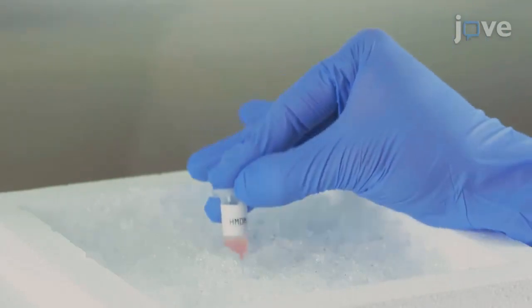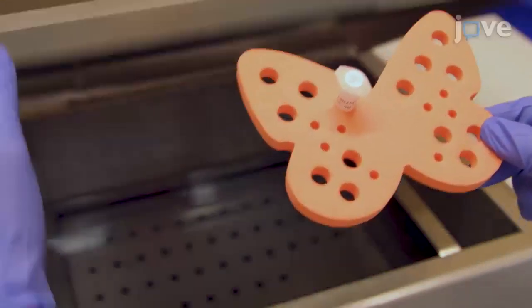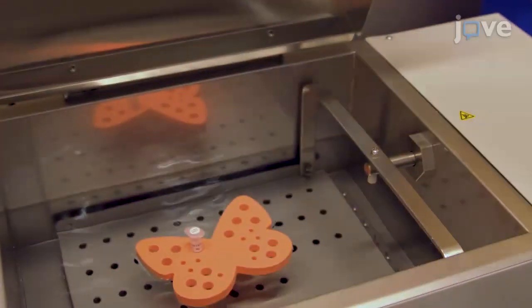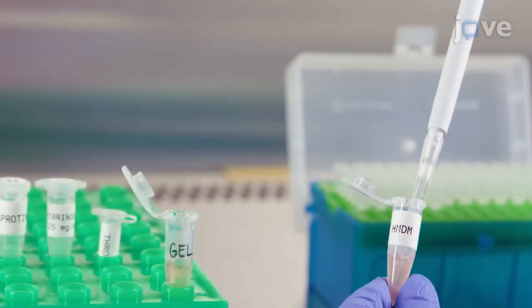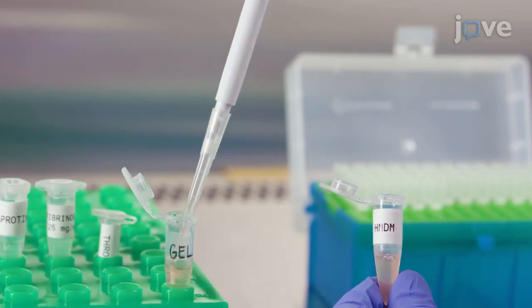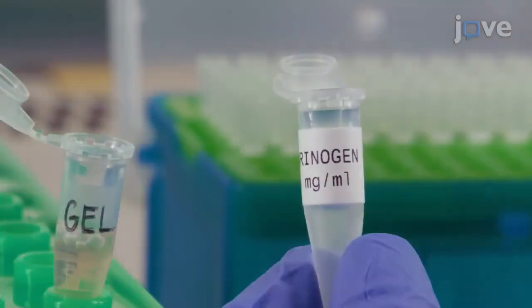To set up a three-dimensional spheroid invasion assay, thaw human myoma-derived matrix on ice and thaw fibrinogen stock solution in a 37°C water bath. When the reagents have warmed, mix together the appropriate volumes of complete medium, human myoma-derived matrix, thrombin, aprotinin, and fibrinogen, adding the fibrinogen just before use.